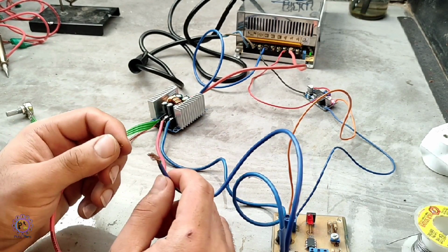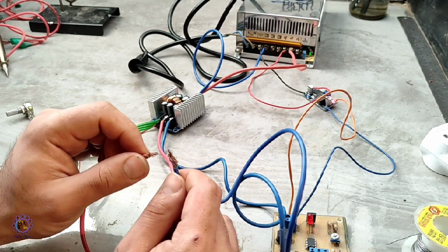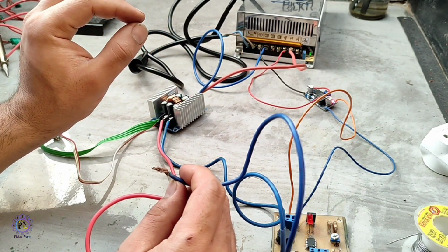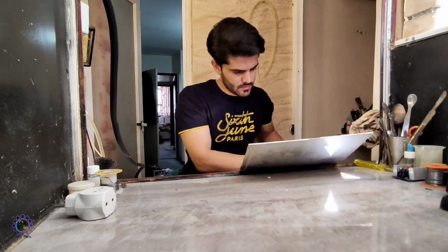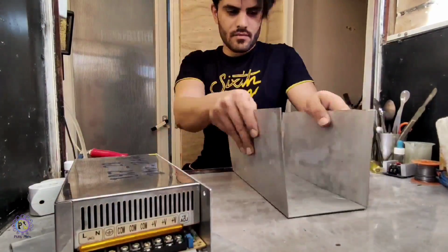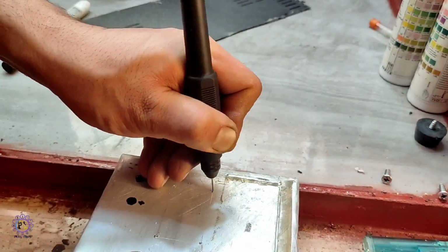As you can see, I'm using a 24 volts and 20 amp constant power supply being controlled with a buck converter of 300 watts and a dedicated buck converter for short circuit protection and cooling fans. Everything looked great, so I started making an aluminum case for my power supply. I'm fond of using aluminum because it can be anodized and colored for a great fancy look. And also I made a front panel for ampere and voltmeters.